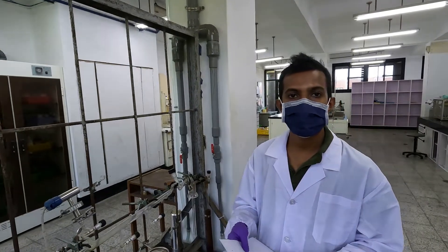Hello, I am Devan. Today, I am going to present you experiment number 3: Vibrational Rotational Spectrum of HCl.